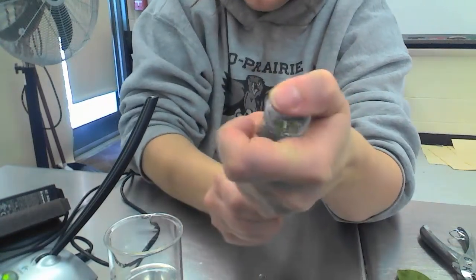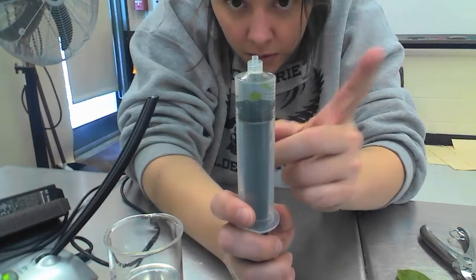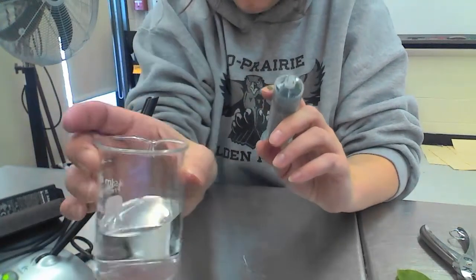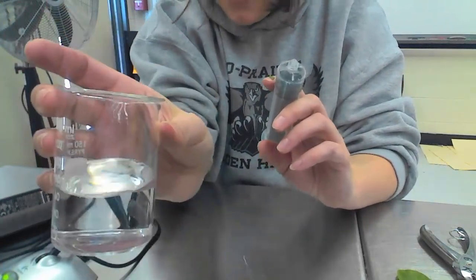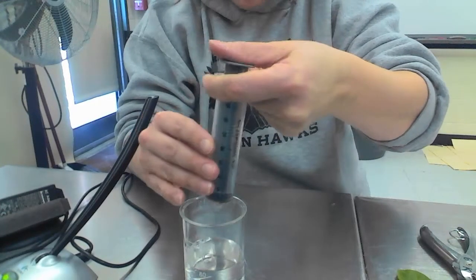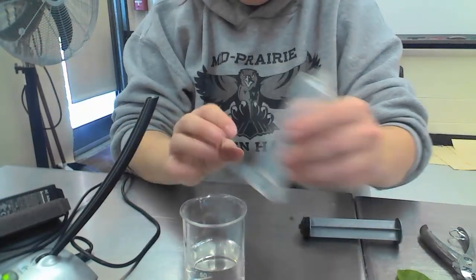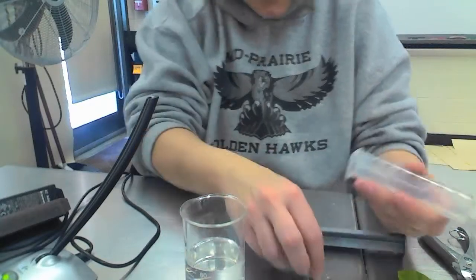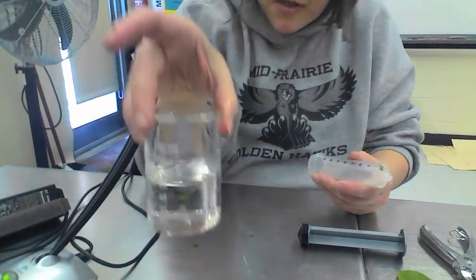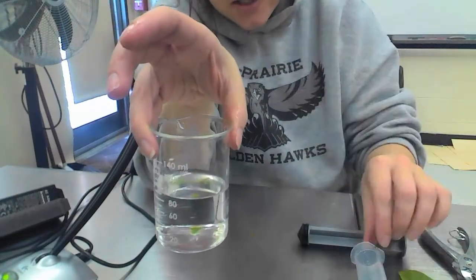You need to continue that until you can get all of them to come down to the bottom. You can start to see that. Now once you have them all at the bottom, you're going to place them into our beaker of carbon dioxide water. So I'm going to do that. Once you do that, you'll notice that they start to sink. So you're going to put all the chads that have no air bubbles in them down into your beaker.